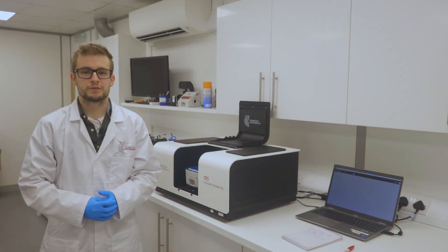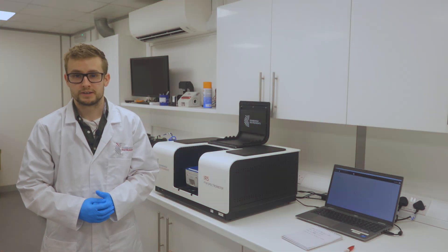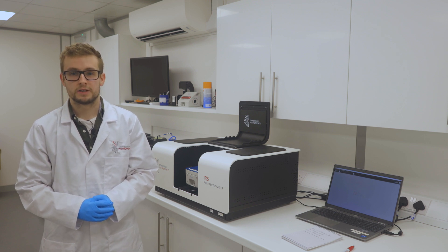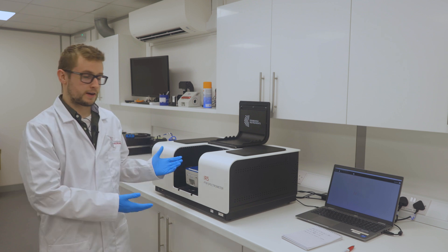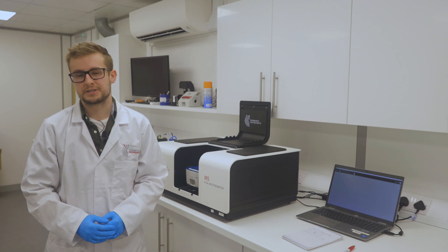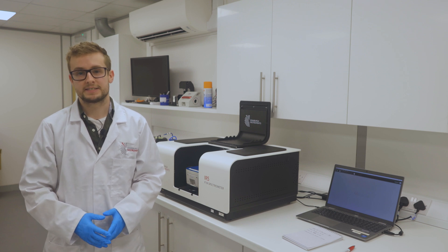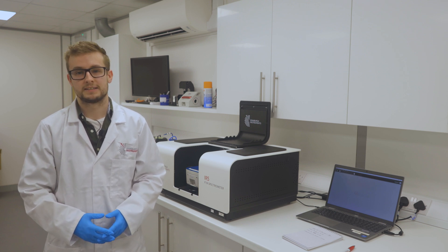Welcome to this Edinburgh Instruments virtual demonstration. Today we will show you how to acquire FTIR spectra using the IR5 spectrometer. We will also demonstrate how to use KnowItAll, an optional upgrade to the Miracle software which provides access to a database containing thousands of spectra. KnowItAll is seamlessly integrated within Miracle to provide easy database searching and simple sample analysis.